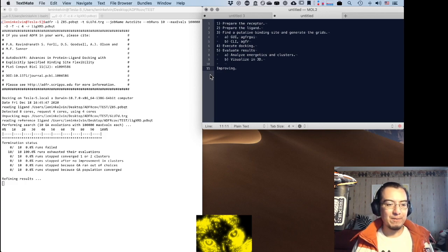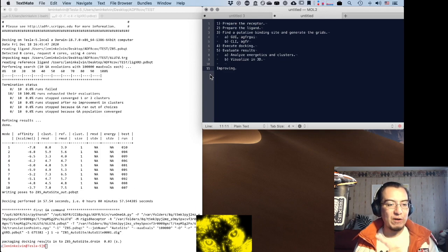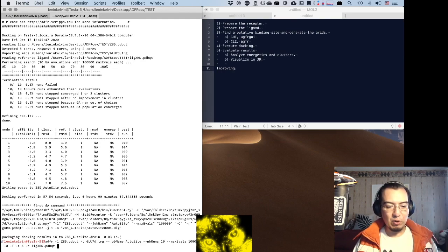Okay, this looks exactly like before. 10 runs are really just too few. Let's see the results. Look at those results, minus 7.8, and a reference RMSD of 3.9. And again, we only get one result per bin. I'm going to change this to 100 and a million, but I'm going to reduce the number of CPUs so we can try and visualize what's going on while this is running.